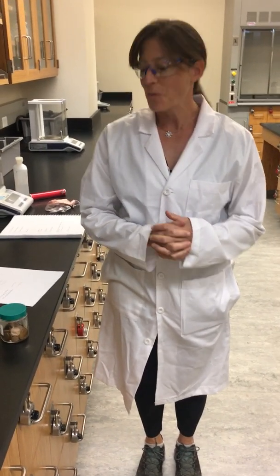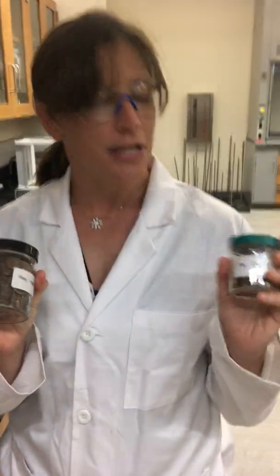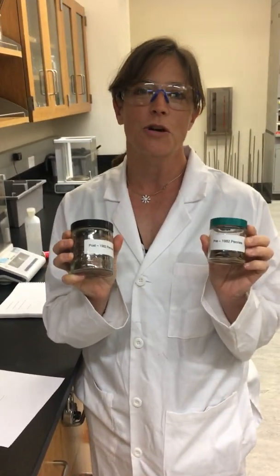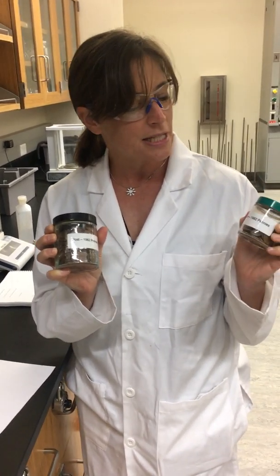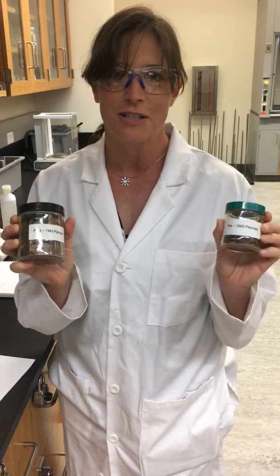Alright, so we are now going to do experiment four. We're going to do part A of the experiment, which is going to use two samples of pennies. We have pre-1982 pennies and post-1982 pennies. These are a representation of isotopes to be able to determine the masses and to calculate their weighted average. Pre-1982 and post-1982 pennies have different weights, and that's why they make a good representation of an isotope.